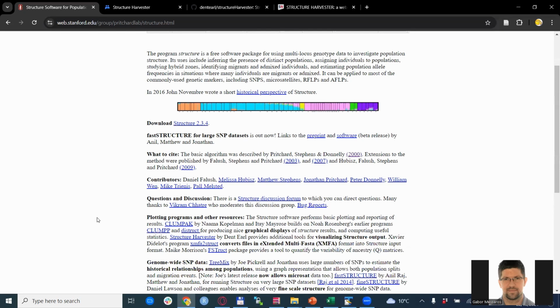Well, the good news is that the author of this structure harvester also uploaded the Python scripts that do exactly the same as the website did. So basically, within this video, we will go through exactly this approach, and we will use this Python script to determine the k-values for our structure run. Before we do so, there are a few things that we should mention.